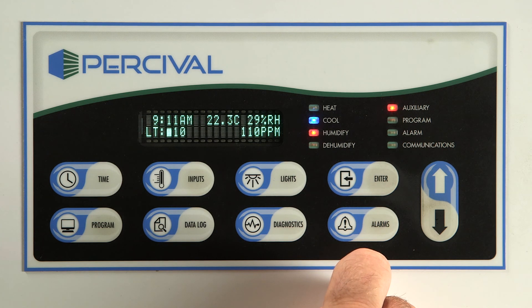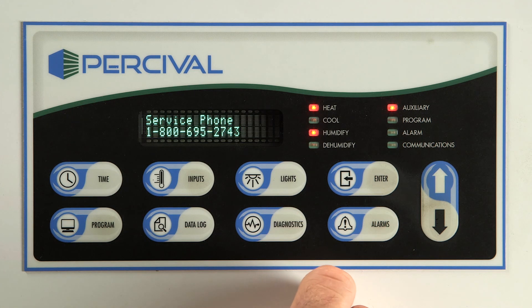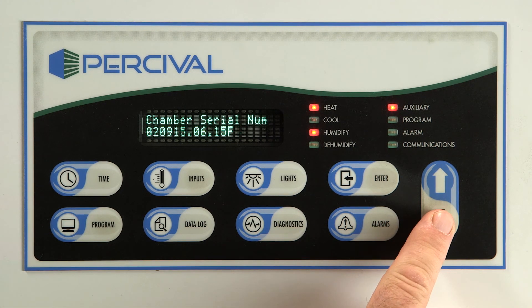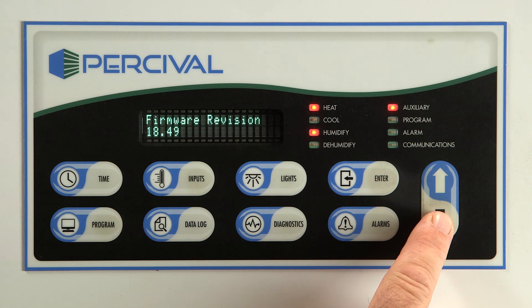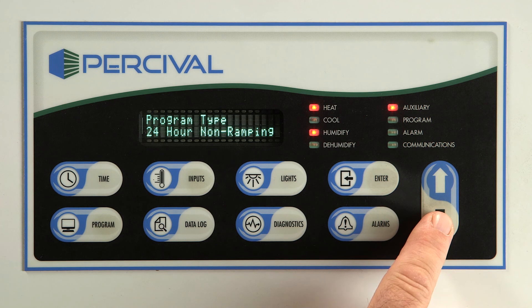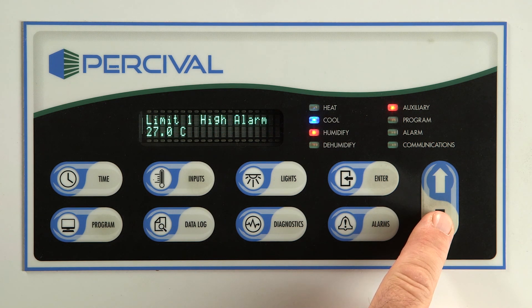To the left of the alarms key is the diagnostics key. This is simply an information loop. It will display Percival Scientific's phone number, the model and serial number of your chamber, and other information that may be helpful if there is a problem with your chamber and it becomes necessary to call Percival Scientific for technical support.